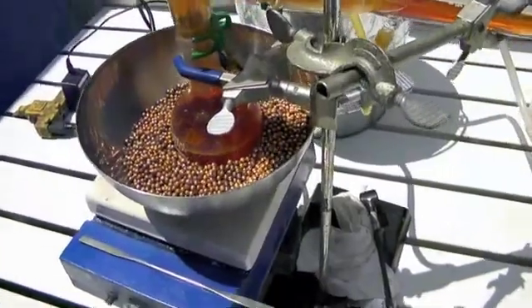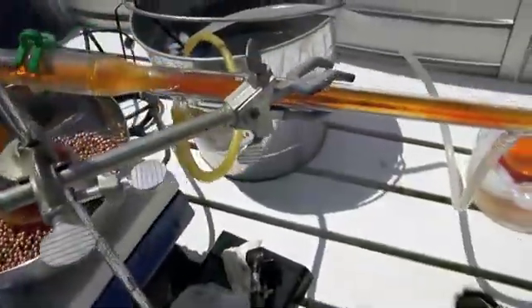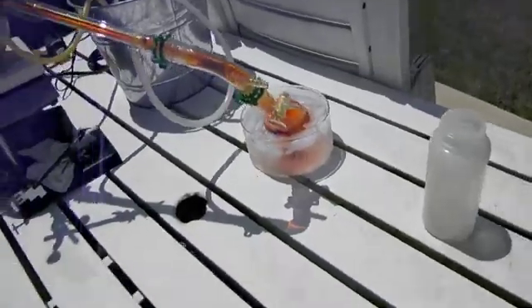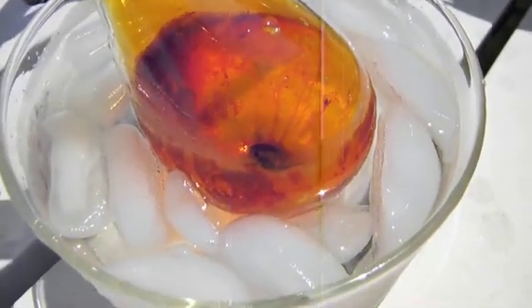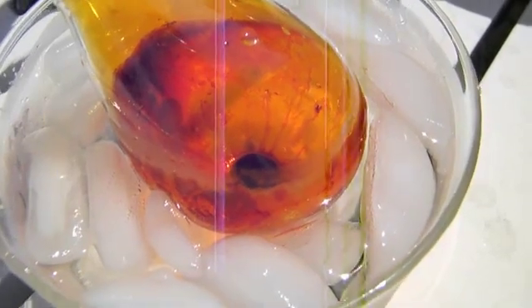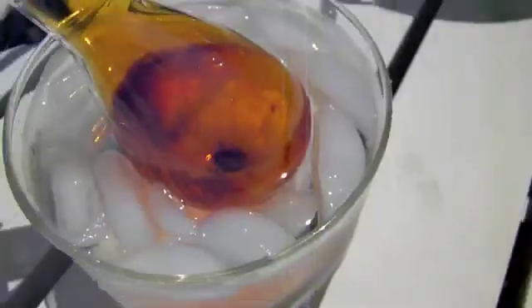We are now near the end of the distillation procedure. The liquid bromine has begun to settle into the receiving flask. The ice bath that I have placed the receiving flask in, as you can see, has condensed a fair amount of the bromine liquid. Unfortunately, the condenser was not doing a fantastic job, so we did lose rather a lot of bromine as vapor.